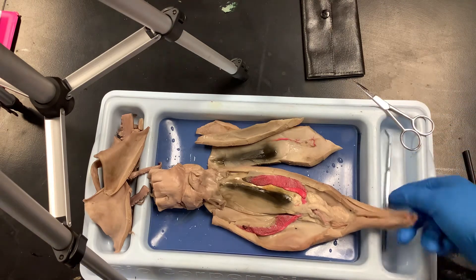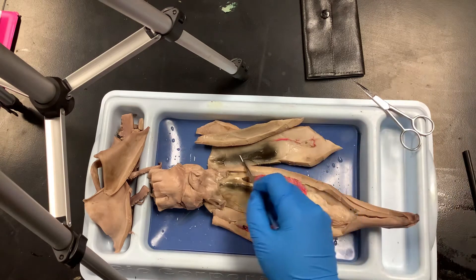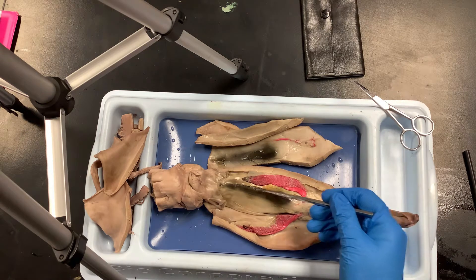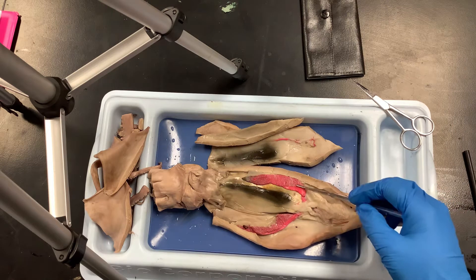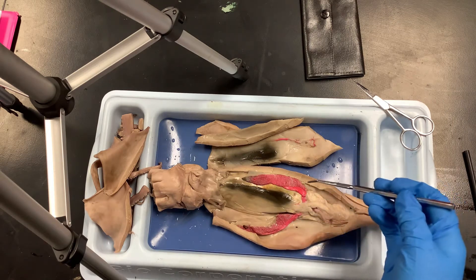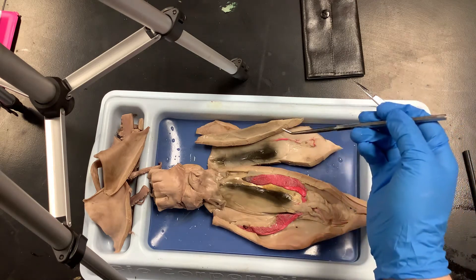If you remove the flap, you should be able to see on the mantle where it looks like it's been stained — that's directly from the ink gland. The really dark gland you see right on top is the ink gland. The pink structures we've already discussed are the gills — for oxygen exchange.